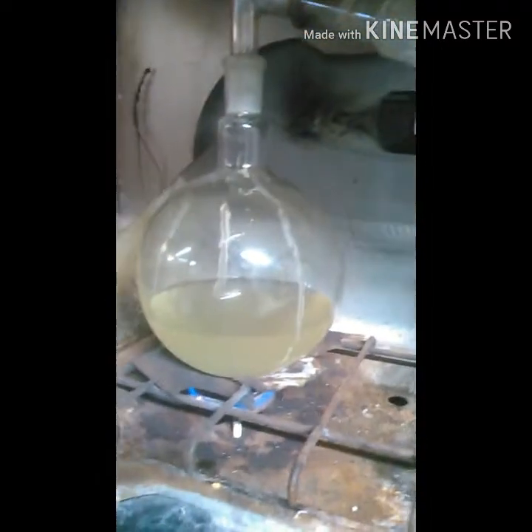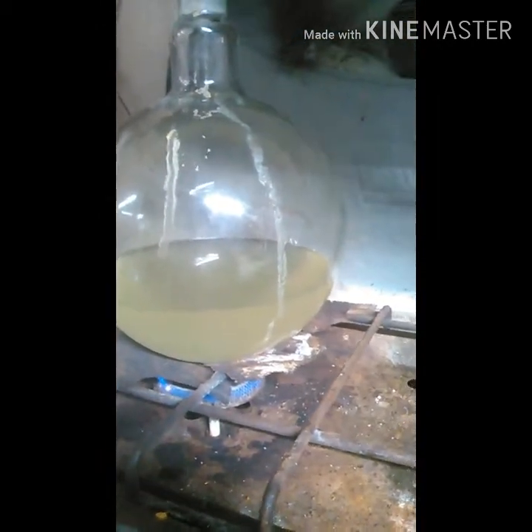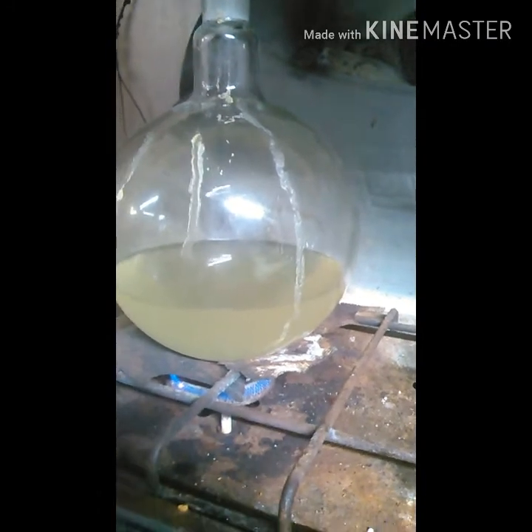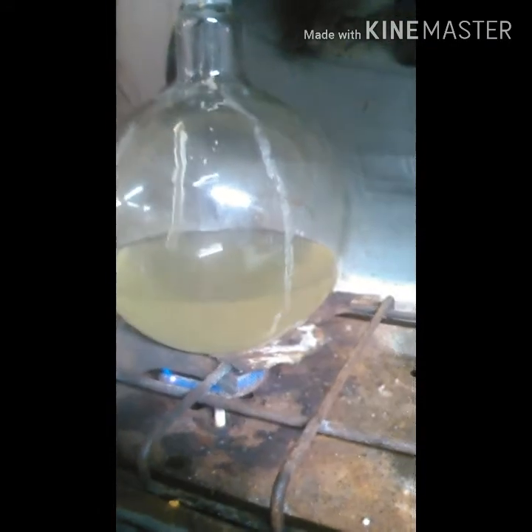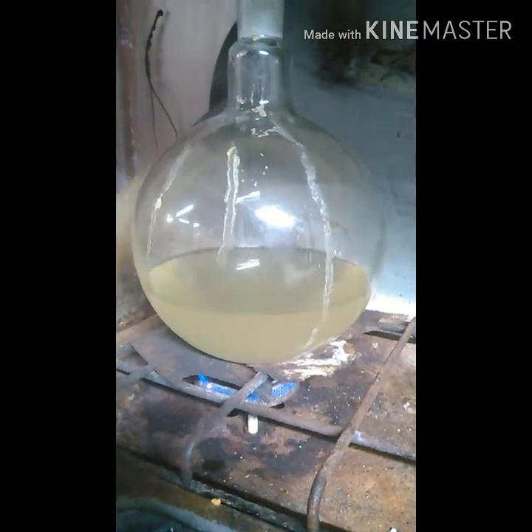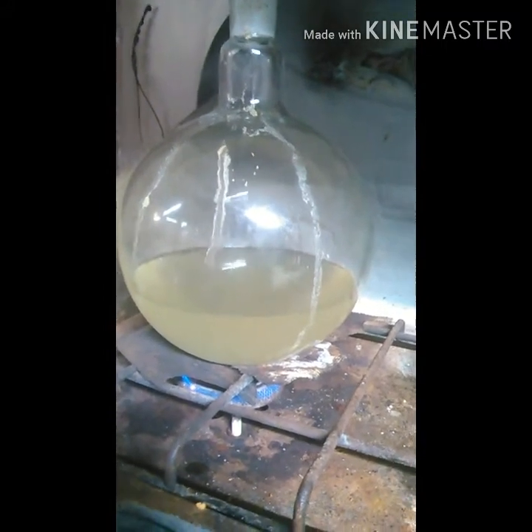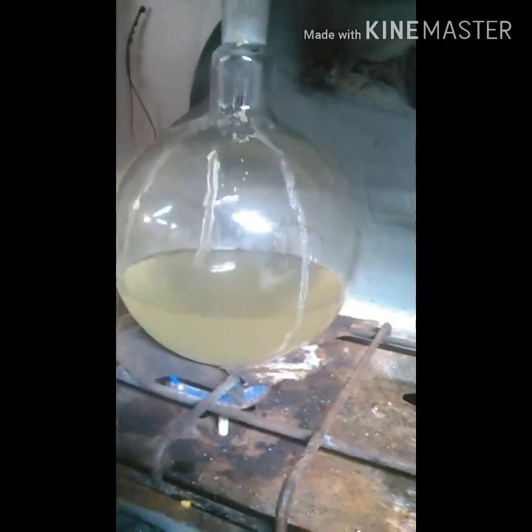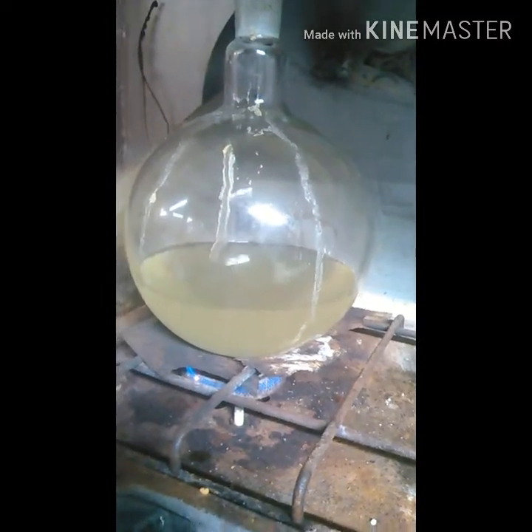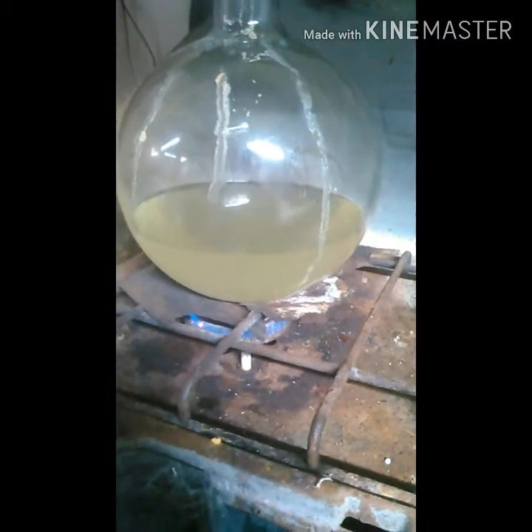This is all I'm doing — basically once it gets to boiling, which only takes a little bit of heat, I turn it off. At negative 28 vacuum it's at about 115 to 117 degrees Fahrenheit. I don't really trust my digital thermometer because it says 120 but I put my hand on it and it's just barely lukewarm.